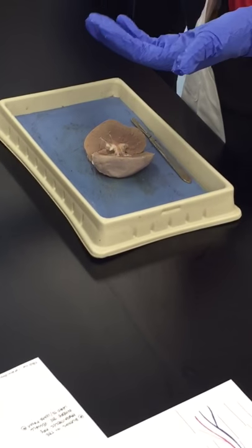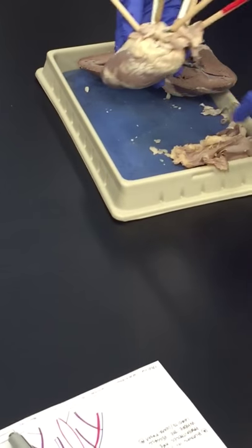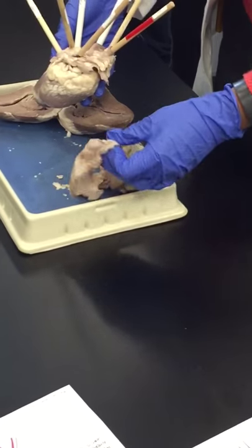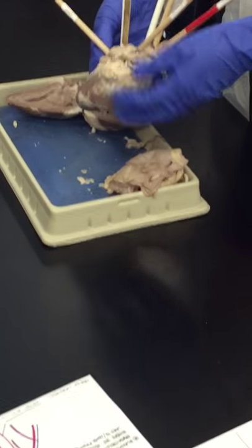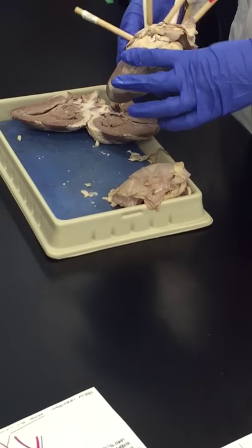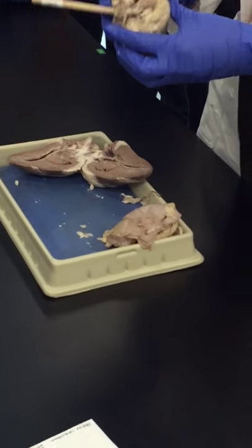This is the pericardium that covers the heart, and all of this tissue and muscle covering the heart - it's a pretty strong muscle.